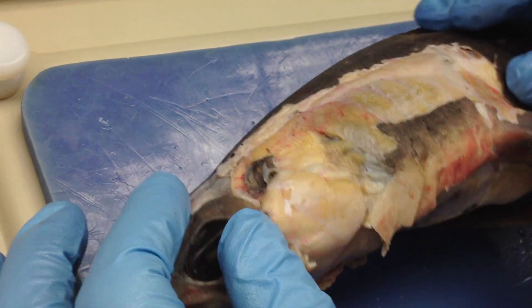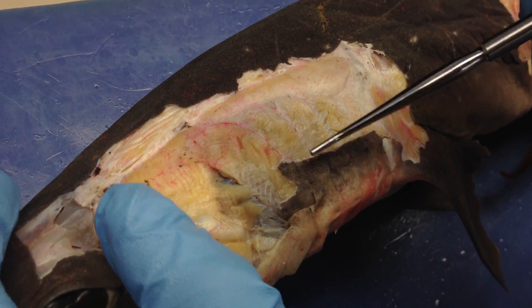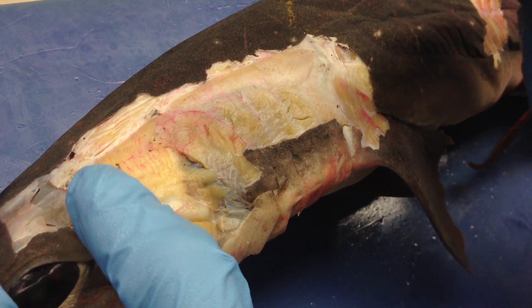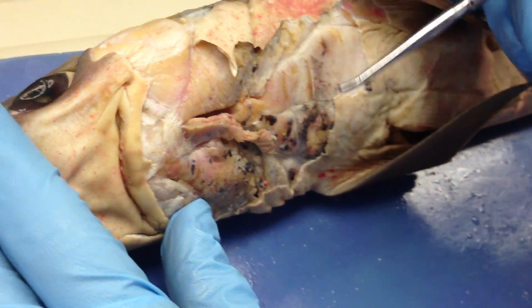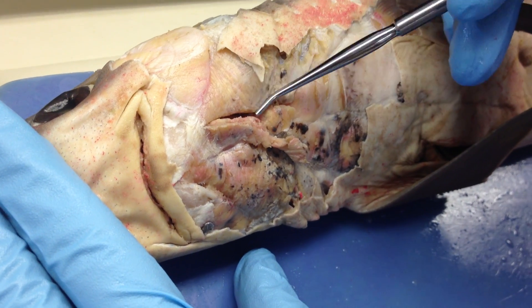The dorsal superficial branchial constrictors are right above the gill arches, right here. Likewise, the ventral superficial branchial constrictors are right here.